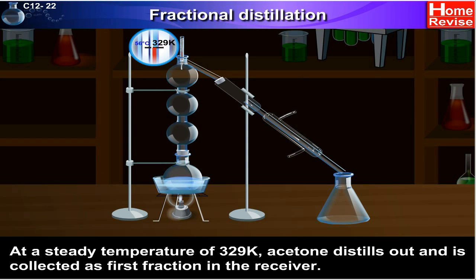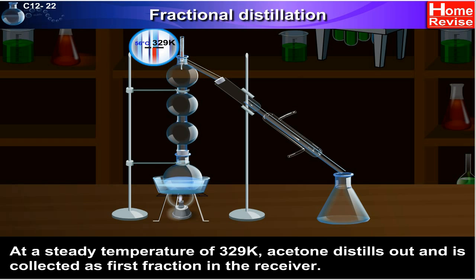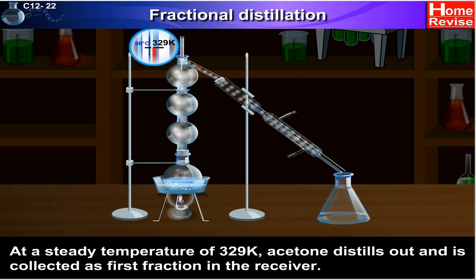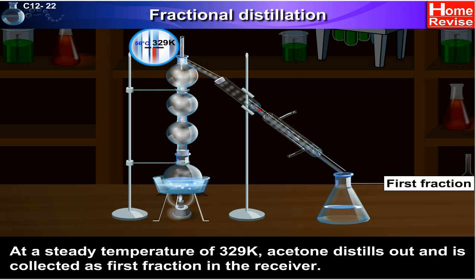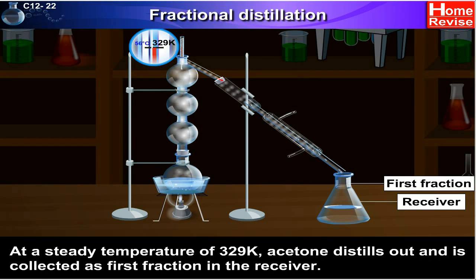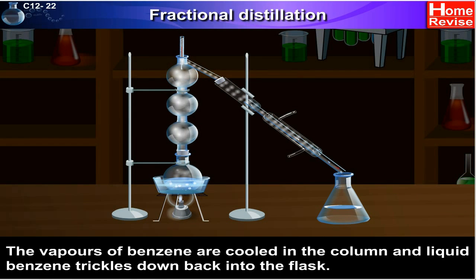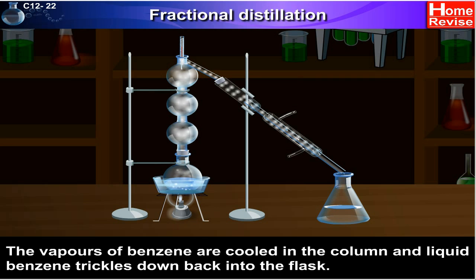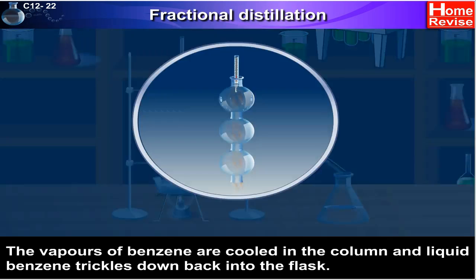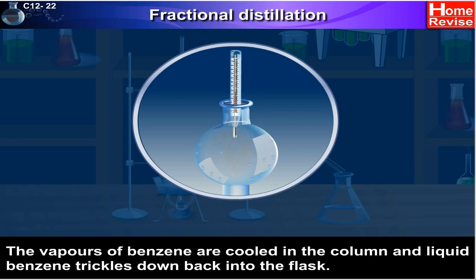At a steady temperature of 329 kelvin, acetone distills out and is collected as the first fraction in the receiver. The vapours of benzene are cooled in the column, and liquid benzene trickles back down into the flask.